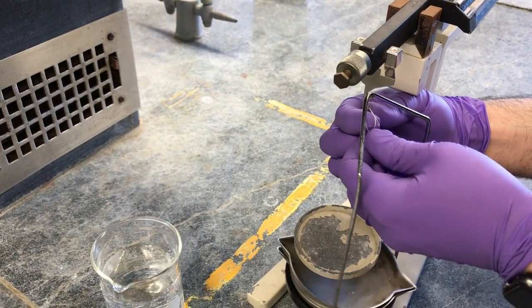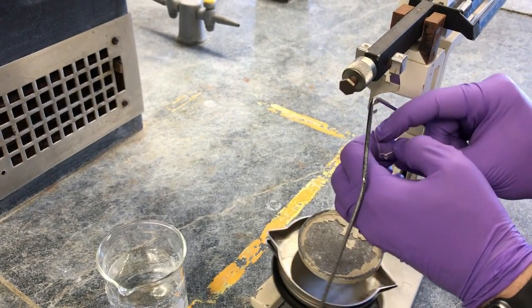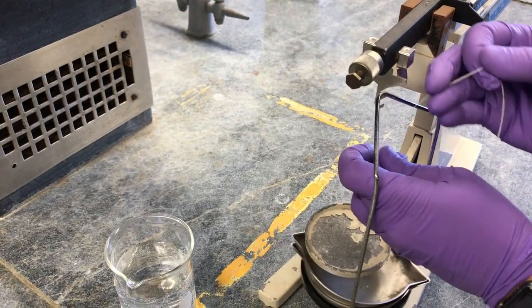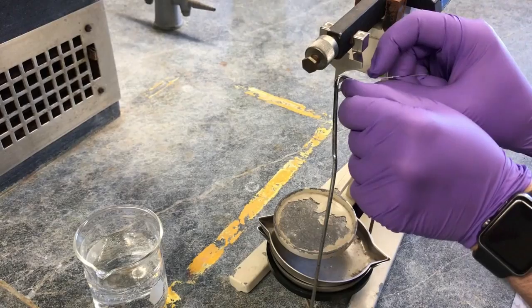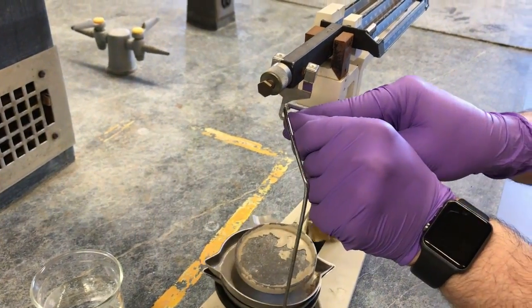And make sure when you do this in lab, you come with your solid already on the string. Don't stand here trying to tie a string while there's a line behind you. That is not a pro move. You'll have people talking, distracting you. It's going to make it a lot harder to do your job.